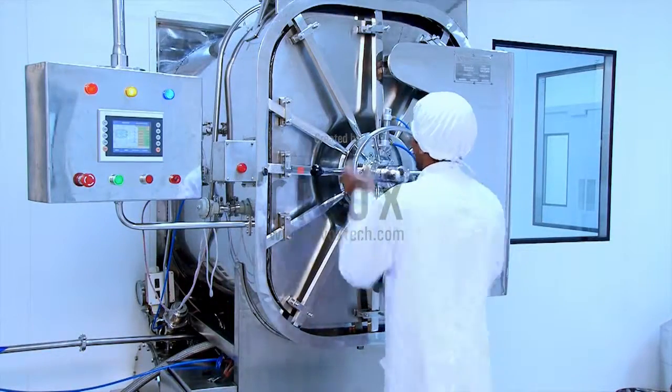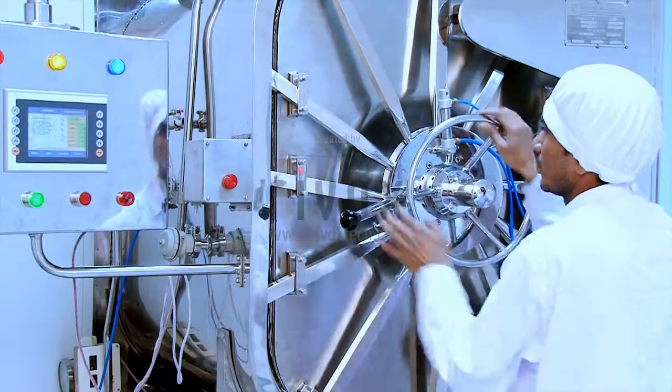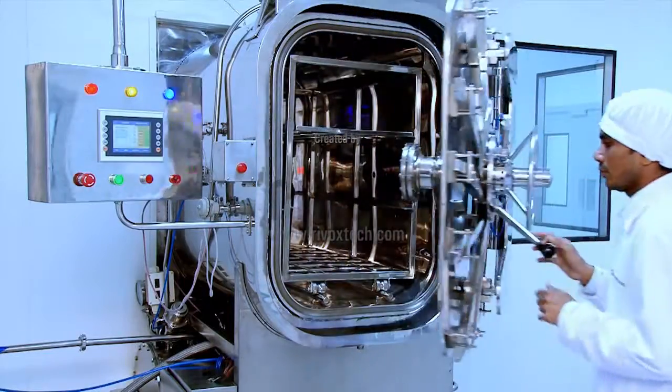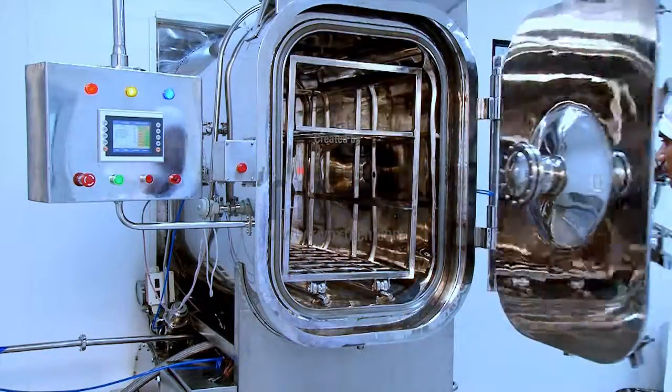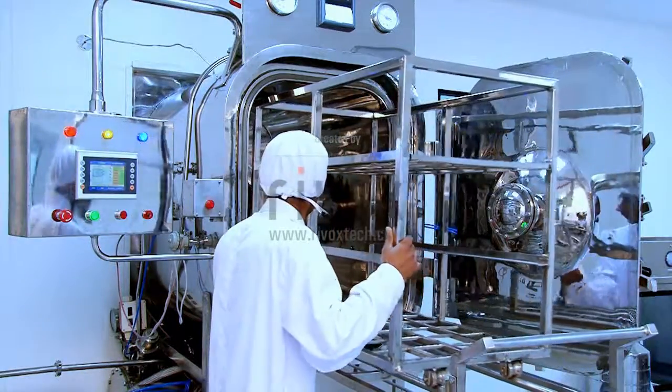The in-situ filter sterilization cycle is developed by Neelam Industries, which is used to sterilize a filter at its own place, so that there is no need to remove the filter from its position for sterilization.